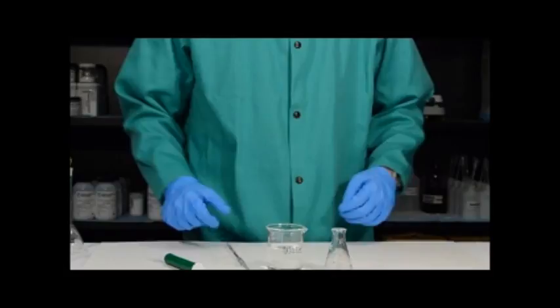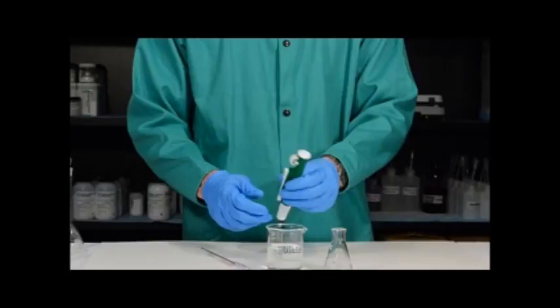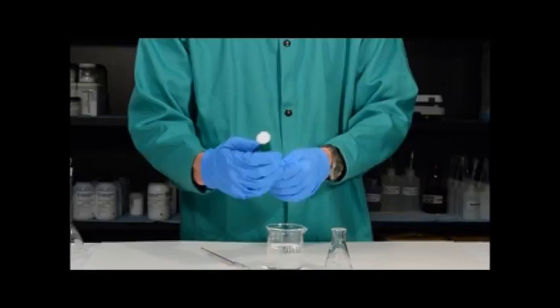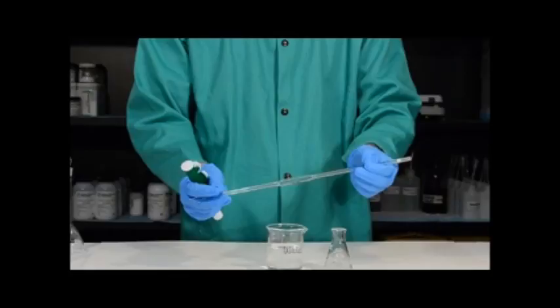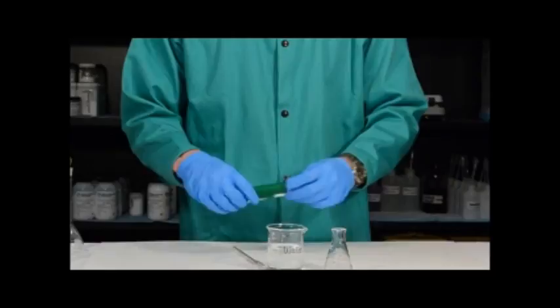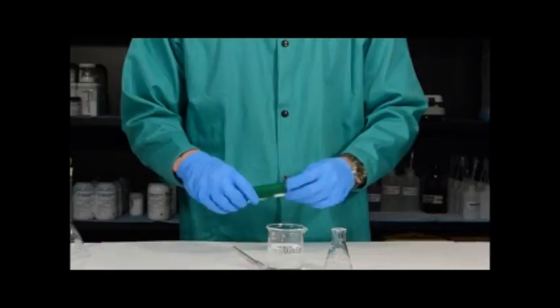In order to use a five milliliter volumetric pipette you're going to need to use a pipette pump, which is designed to draw liquid into a pipette. This is done by simply scrolling the wheel and sucking the water up into the pipette. It's much better to draw in more liquid than you need and then drop the volume until you have exactly five milliliters, and I will demonstrate that for you now.